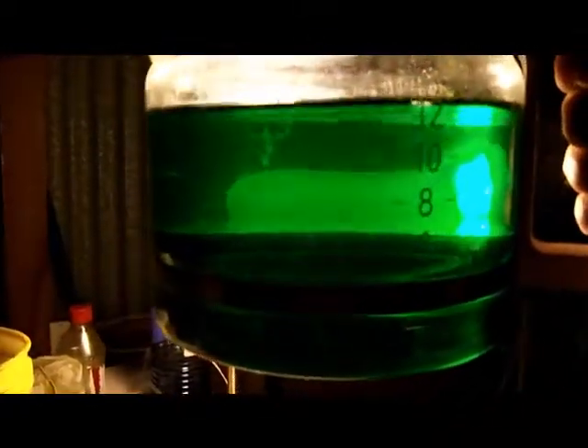After 60 hours of electrolysis, I noticed my solution is now a beautiful emerald green. It doesn't show on the camera quite as well — it looks a little yellowish — but it's actually just a beautiful emerald green. I love that color. It's got that green color still, and it's not safe for disposal yet. It can still have nickel in it, copper in it — basically metallic salts.